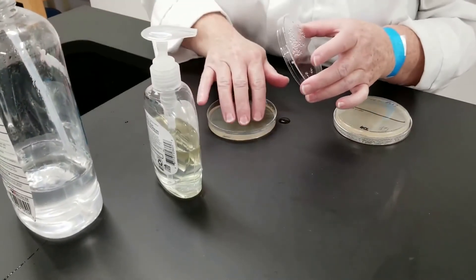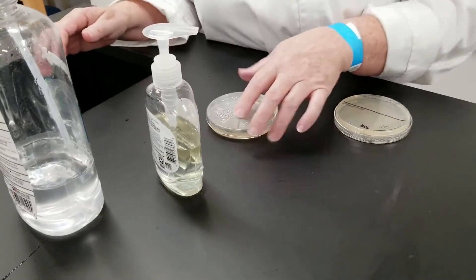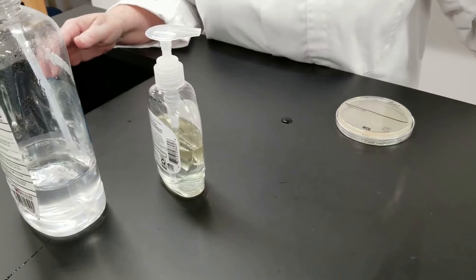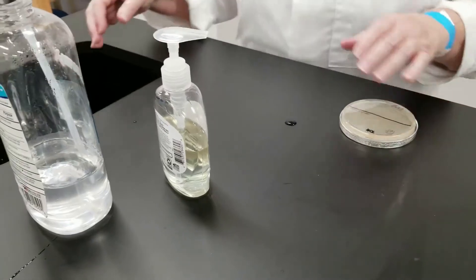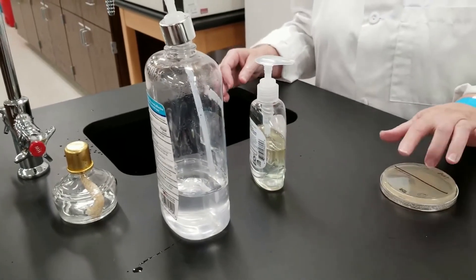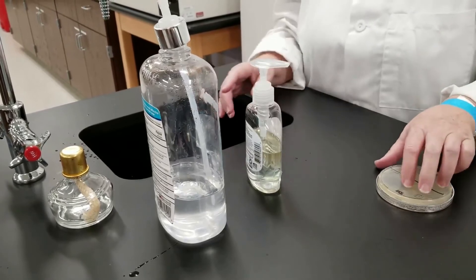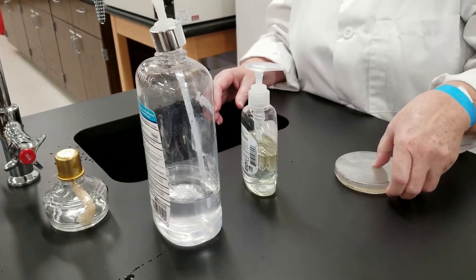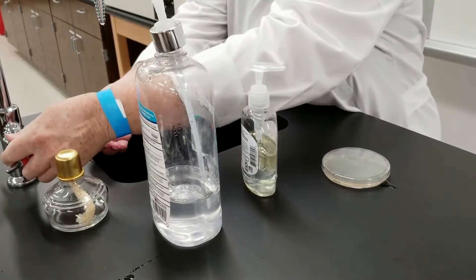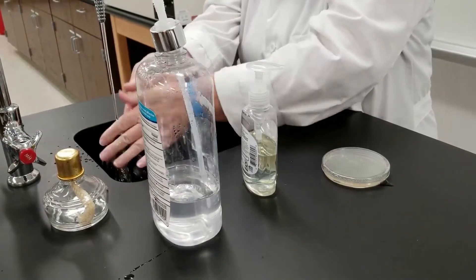I'm just going to touch my fingertips here. We're going to incubate these plates. Now on this plate, we're going to use the hand sanitizer, and I'm also going to wash my hands for at least 30 seconds, which is what the recommendation is.